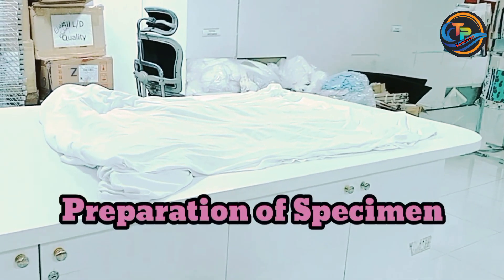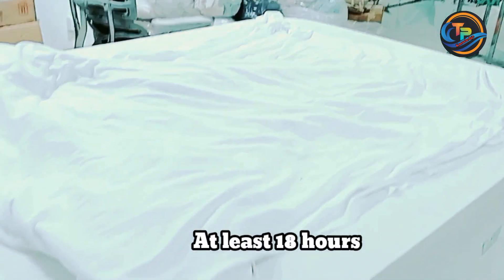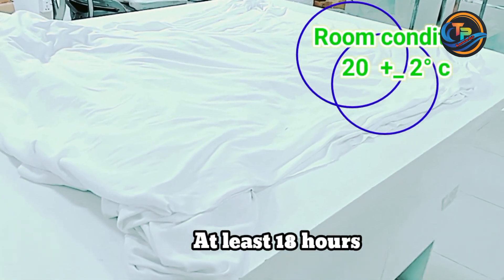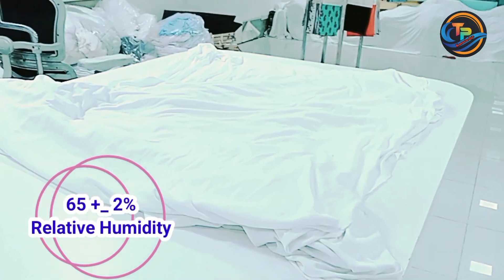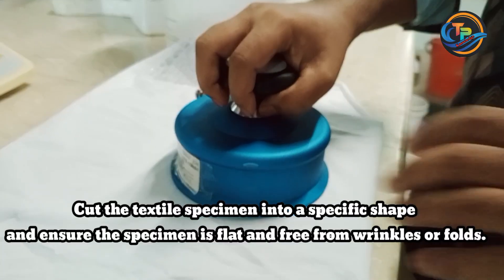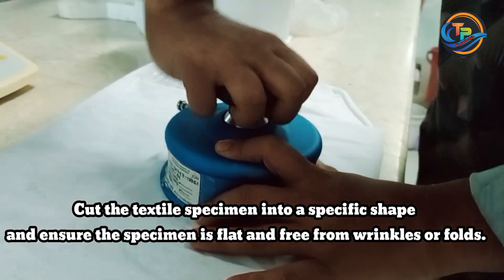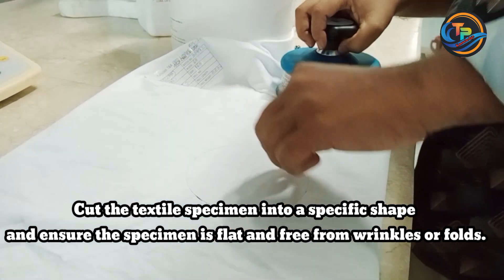For preparation of the specimen, the fabric should be conditioned and relaxed for at least 18 hours, maintaining room conditions of 20 ±2°C and 65 ±2% relative humidity. Then cut the textile specimen into a specific shape and ensure the specimen is flat and free from wrinkles or folds.